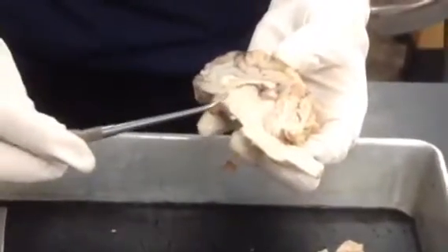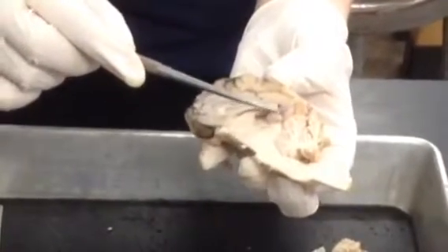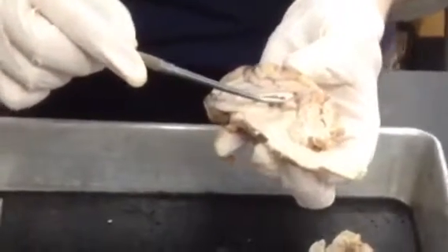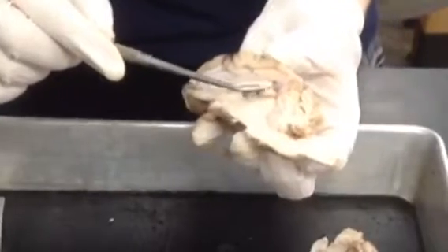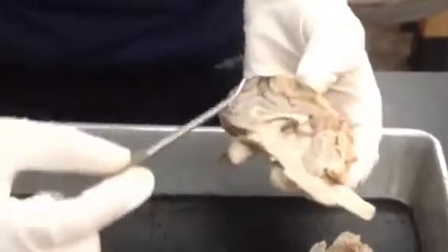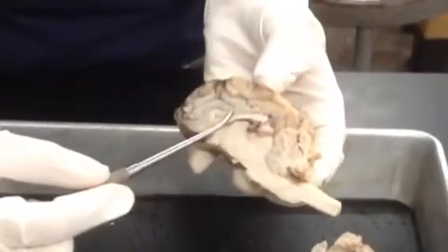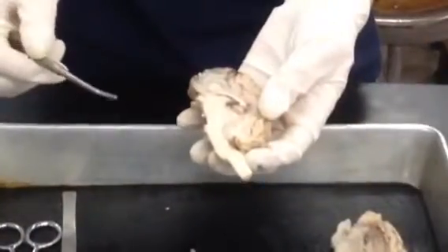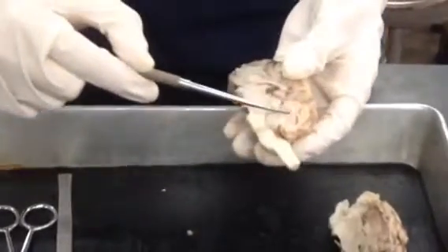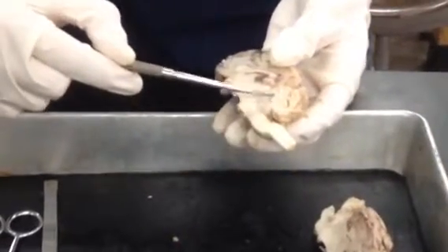So this is the pineal gland. It is a small gland posterior to the thalamus. The pineal gland secretes the hormone melatonin and it contributes to the regulation of sleep activity cycles. This white area that forms the arch is the corpus callosum, and the corpus callosum is what holds the two hemispheres of the brain together. Now we're going to look at the cerebellum again. This white matter inside is called the arbor vitae, which means tree of life. This helps us with coordination and balance of the rest of the body.